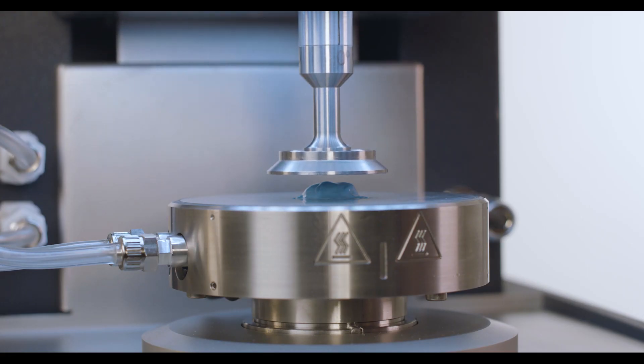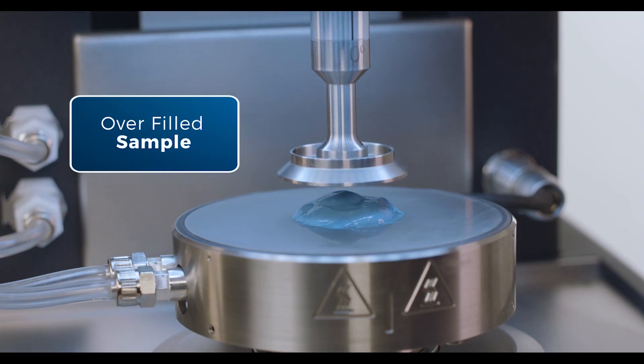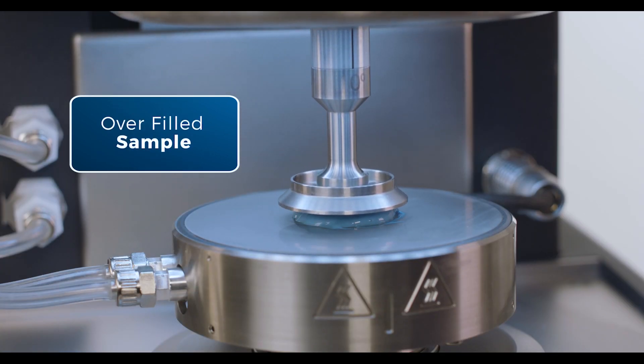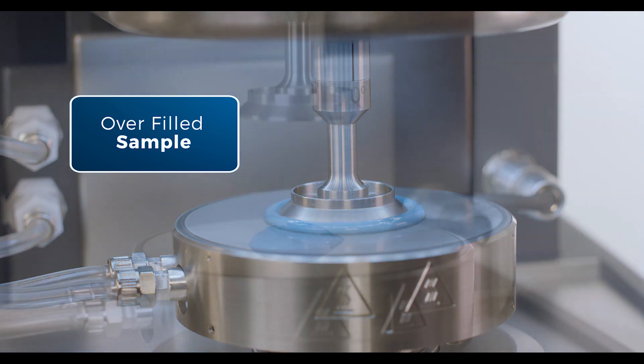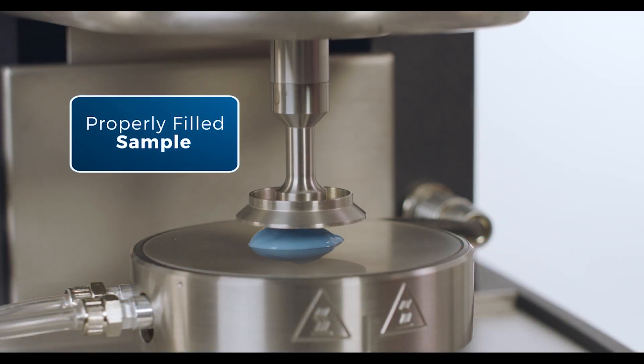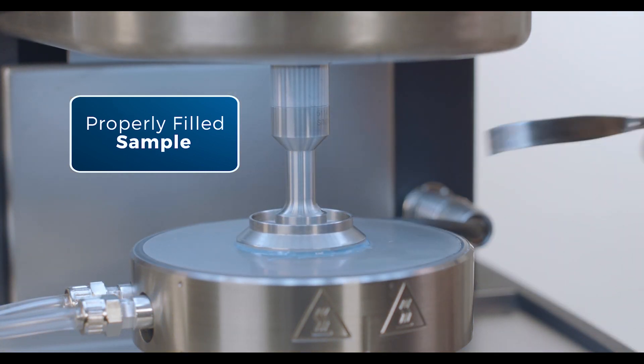In this case, you won't have to worry about underfilling or sample centering. Proper sample loading is critical to ensure accurate testing results. Here we will demonstrate how to properly load a sample onto the Discovery Hybrid Rheometer using either the instrument touch screen or TRIO software.